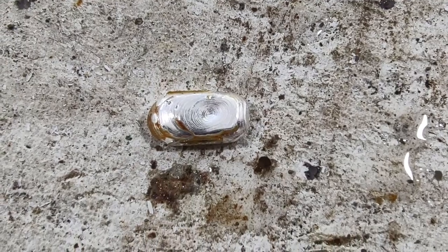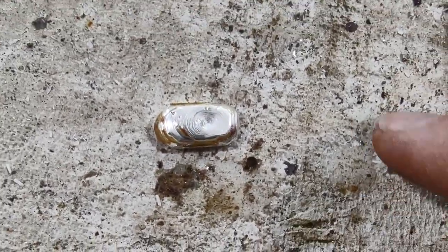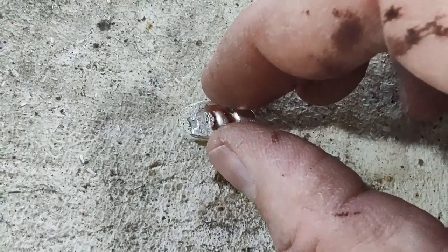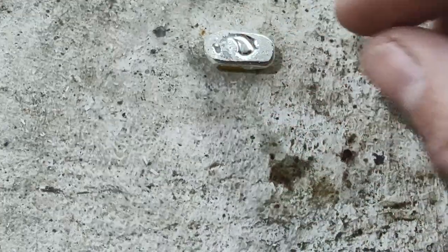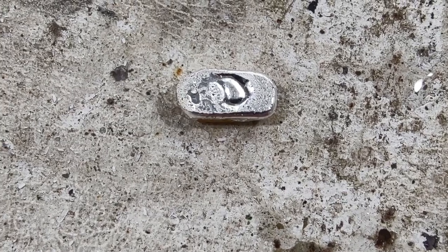So here's our bead. Still got some borax stuck on it. But look at those flow lines. Nice. And then how shiny it is. Oh my goodness. It is shiny. Yeah, I need to clean the borax off of it and add it to my collection. So there you go.